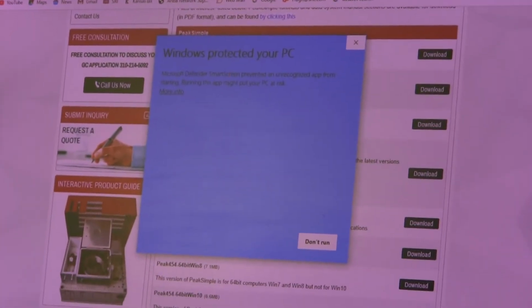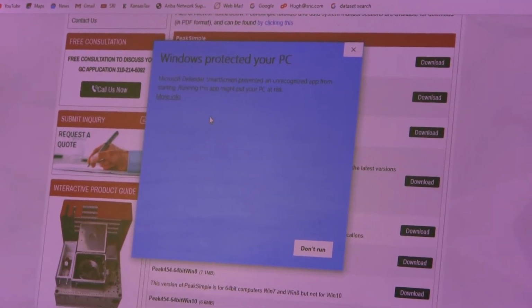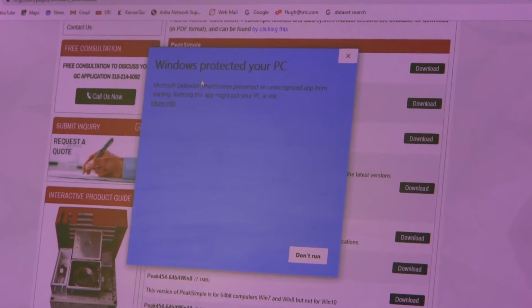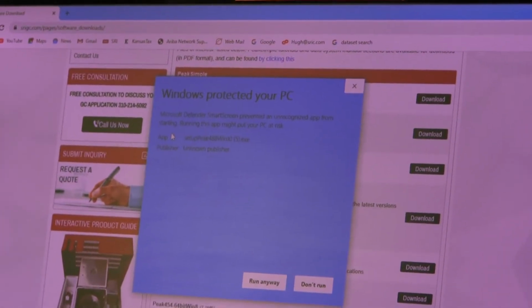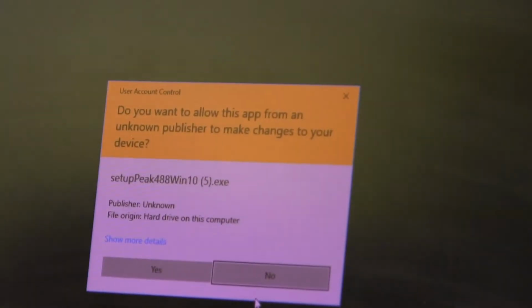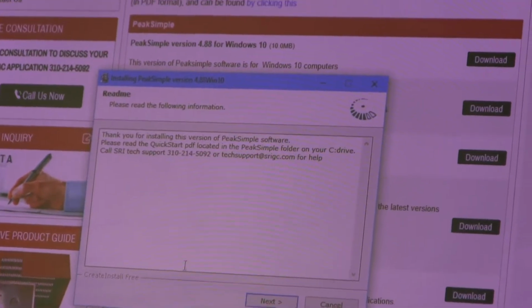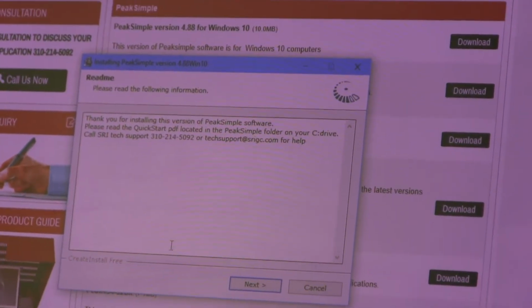And Windows tries to protect you from us because they're not sure if this is a virus or not. So you have to override Windows by clicking more info, and then you have to say run anyway. And then you have to give another permission by saying yes, and then finally you're at our installation program.